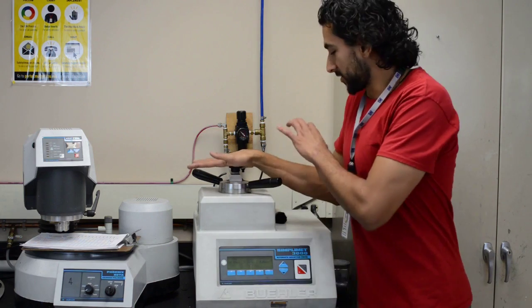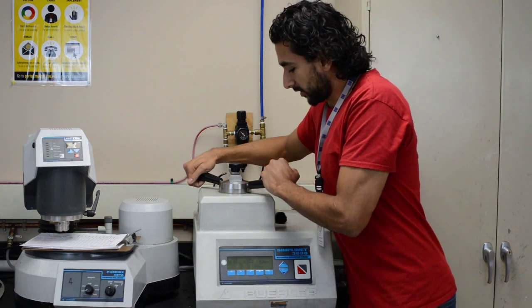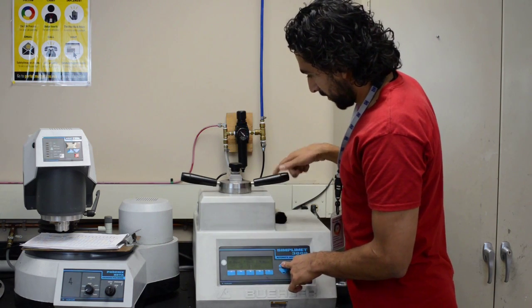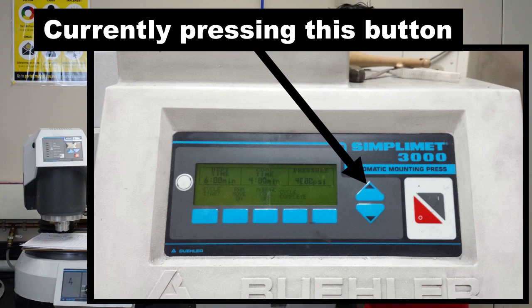All right, so it's done. Now, the way I take this out is just twist it. Pump it up.